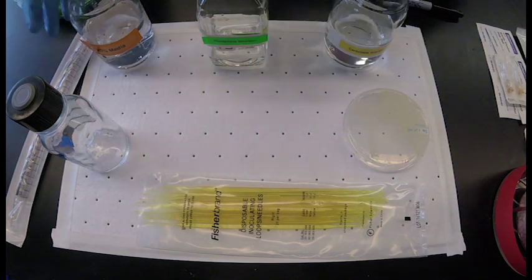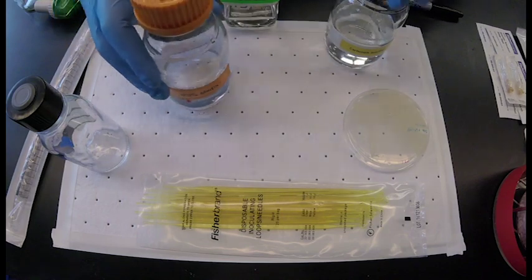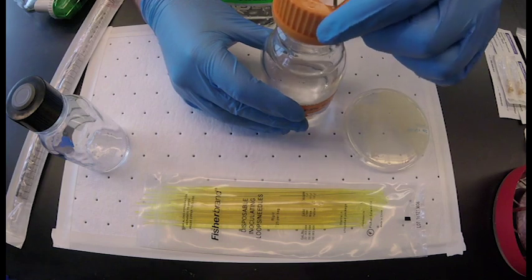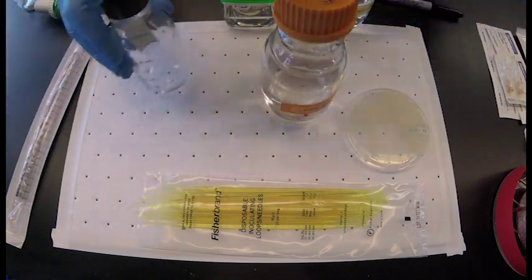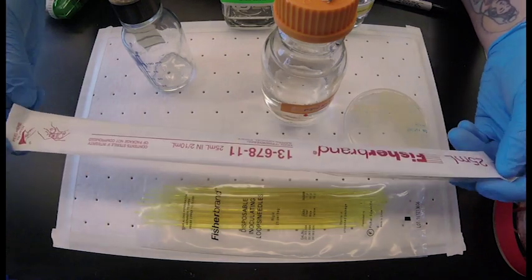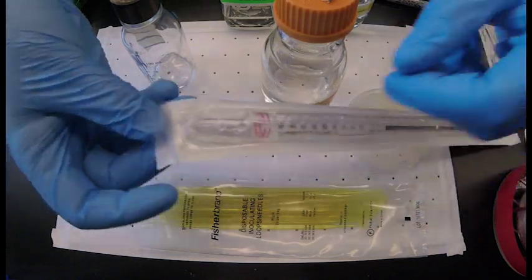Loosen the cap on your media. Dispense your media using a sterilized serological pipette. We will use 25 milliliters in one culture.